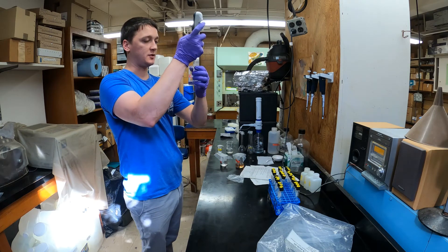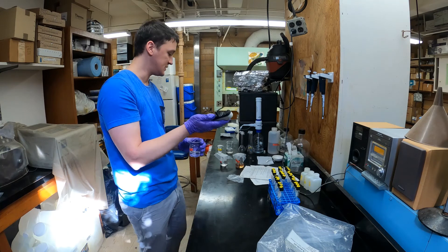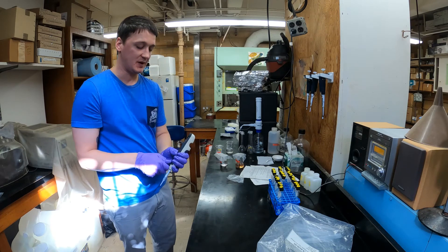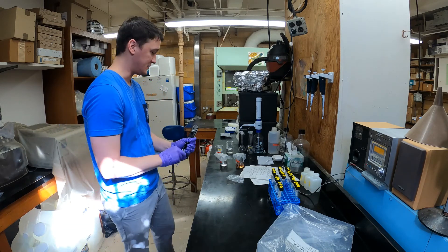All the tubes have got the phenol now. I'll go ahead and repeat this with both the nitroprusside solution and the oxidizing solution, which is made up of an alkaline solution and bleach — both are necessary for the reaction.